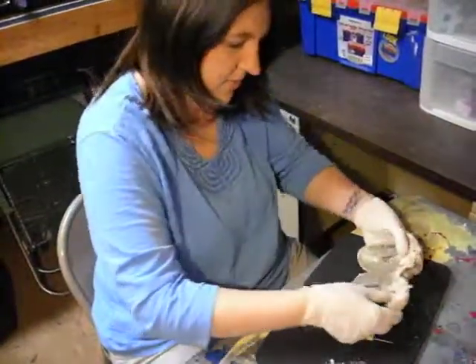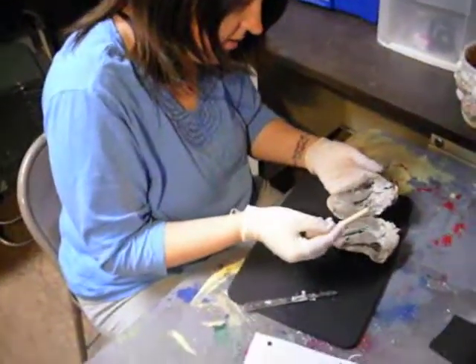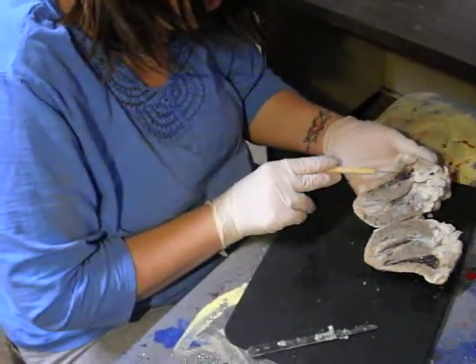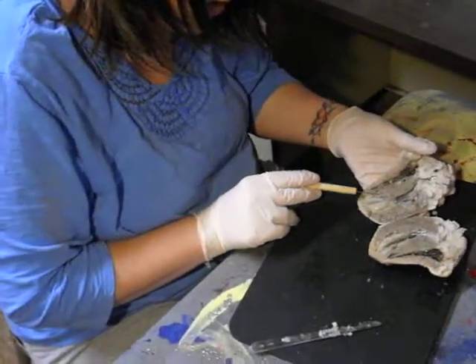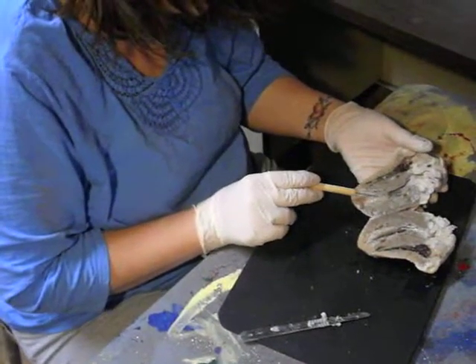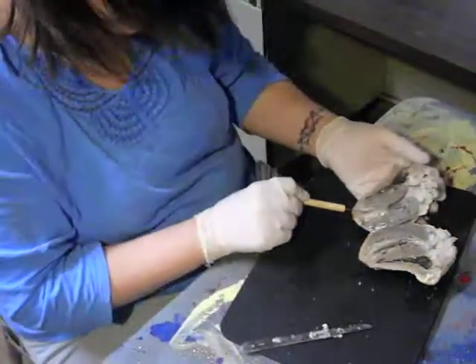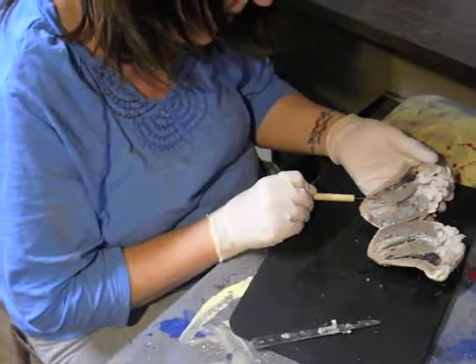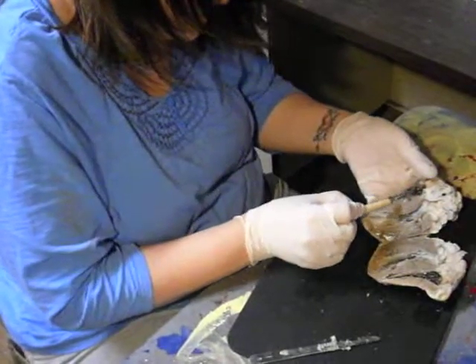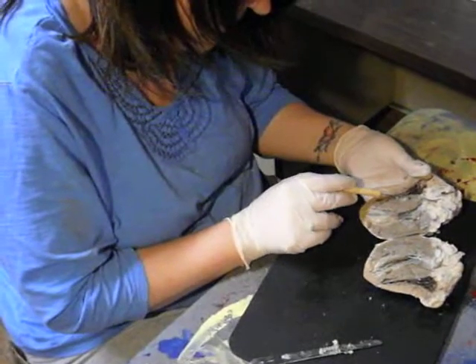And here's the inside of my heart. Right here is the right atrium. Down here would be the right ventricle. This right here is the interventricular septum. And here's the papillary muscle. The tricuspid valve is right in here between the atrium and the ventricle.